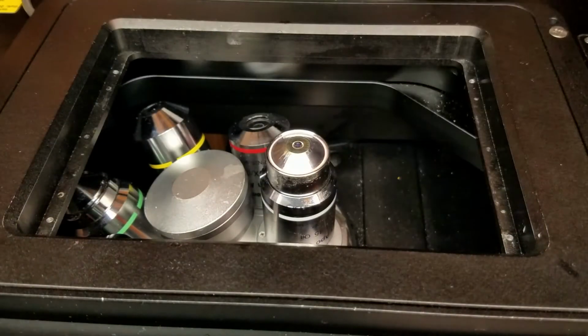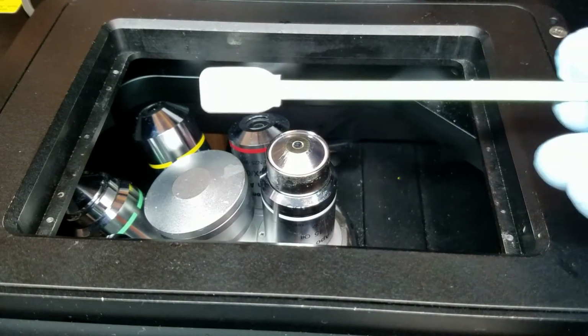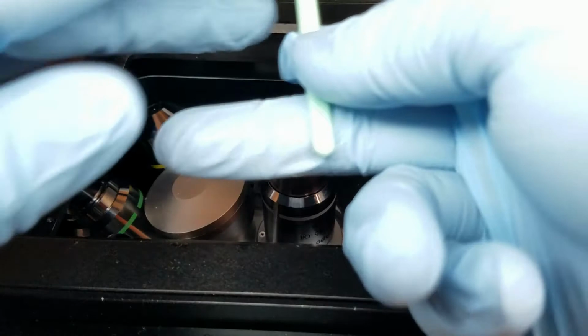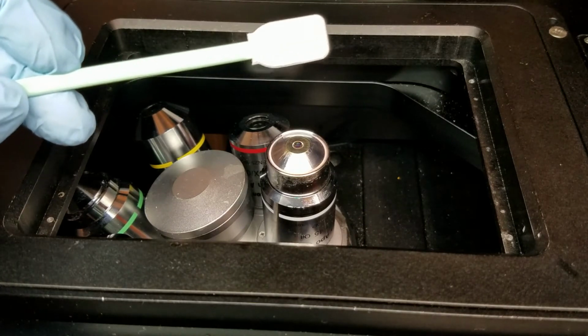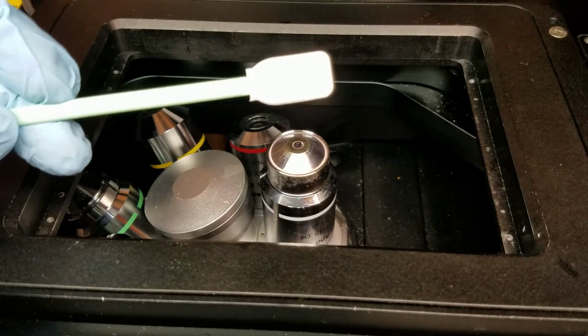Perfect. Great. The next thing we're going to do is we're going to grab one of our micro denier swabs. They're just little paddles. They look like this. They're in a white and green plastic bag. The purpose of these swabs is to remove the tacky oil. Now what I'm going to do is I'm going to get either lens cleaner or use our little squeeze bottles of ethanol and actually put several drops on here.